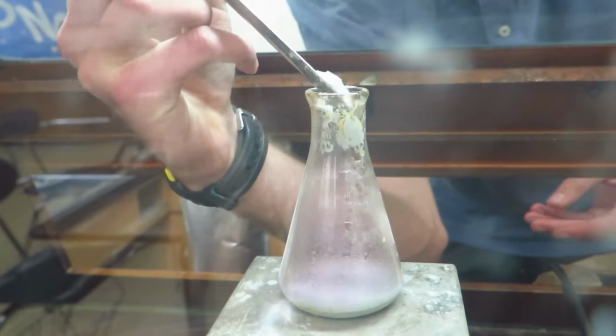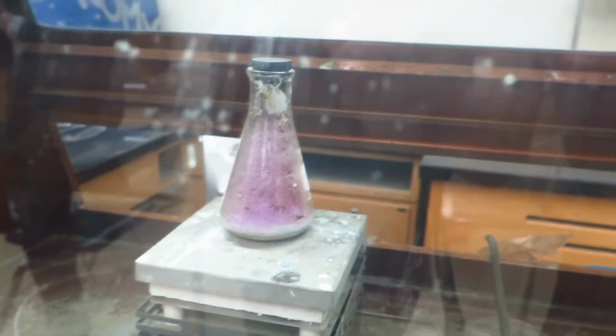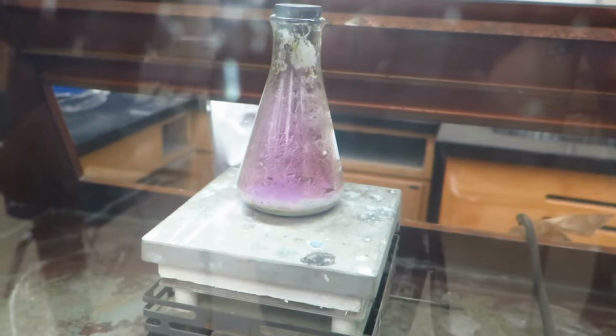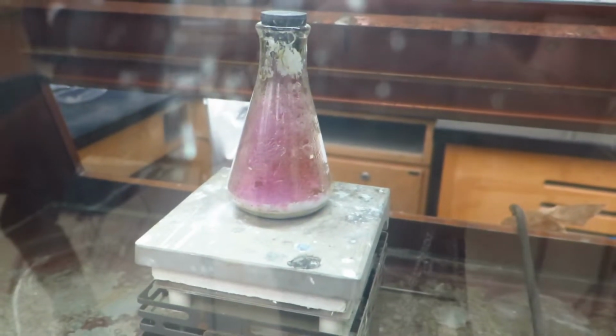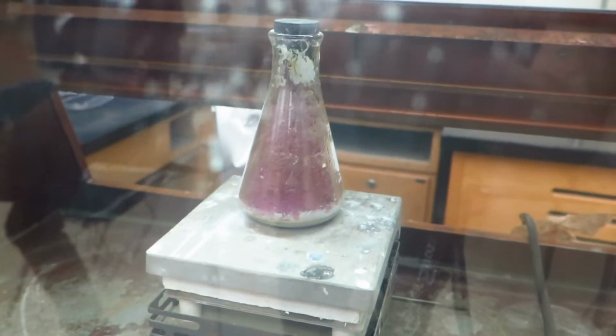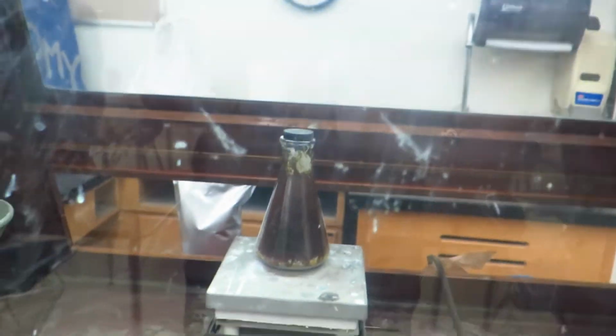I wouldn't smother it with extra because it looks like it's purpleizing. Starting, I think. Yeah, it's starting. Look at that. Oh yeah. But, oh, for sure. Oh yeah. All right, go ahead, and can you hold this camera? I can definitely hold that.